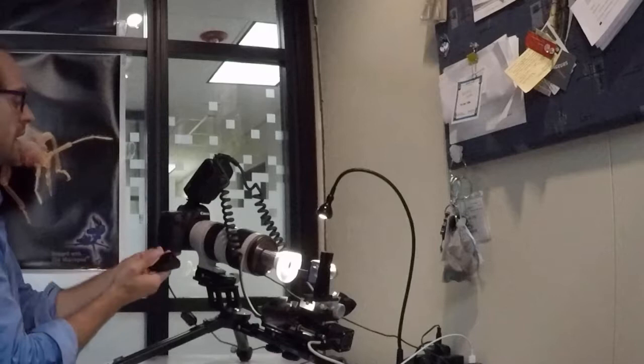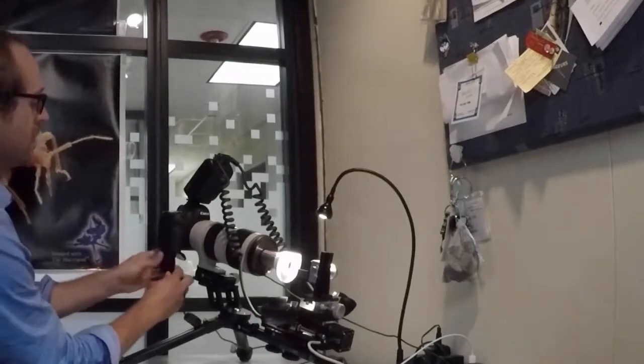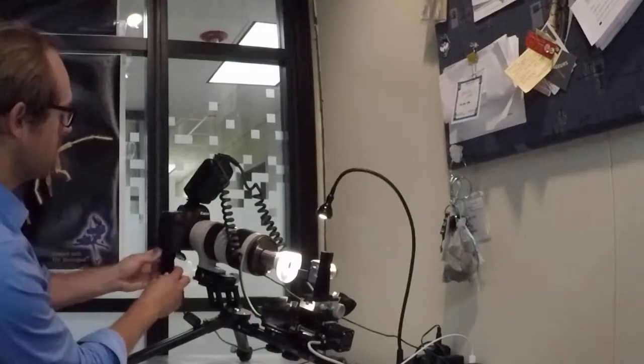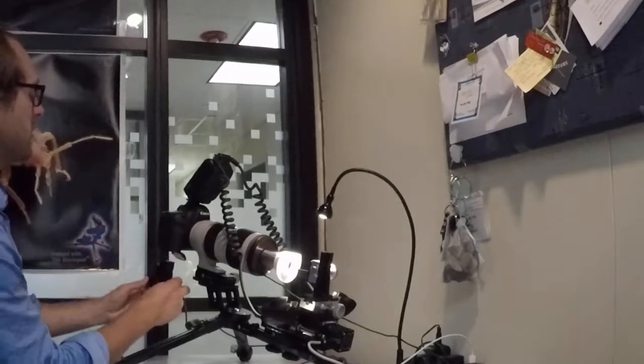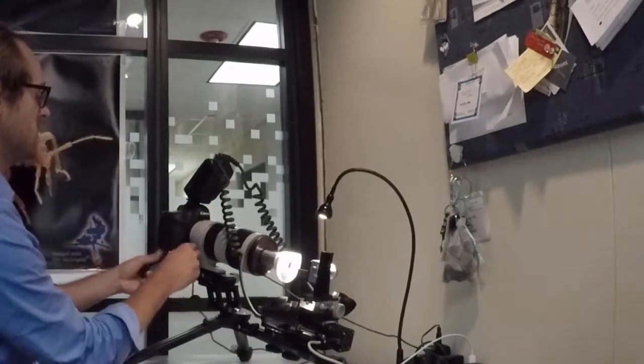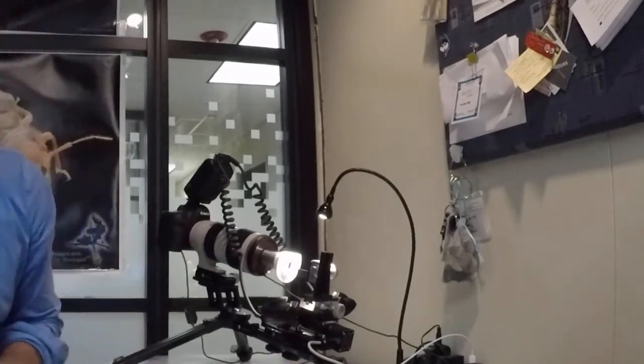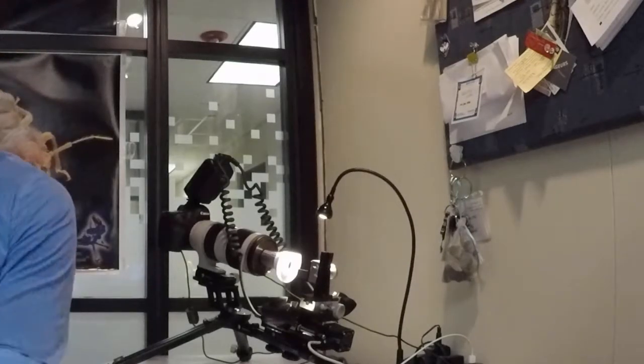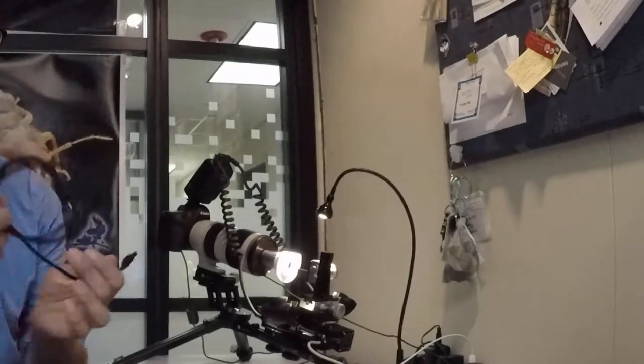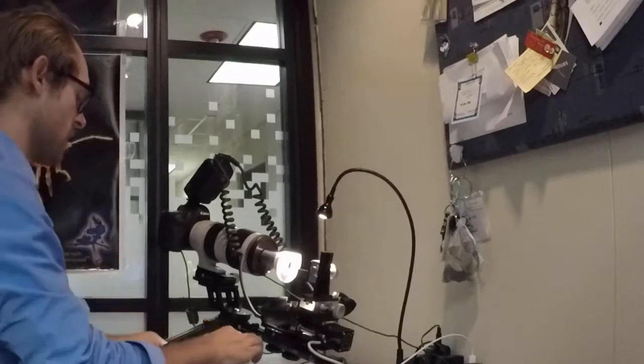And then I'm going to plug in the power pack for the camera. I've already got a battery in there we'll just take that out. And then we're going to take our final cable which connects the Stackshot controller to the camera.